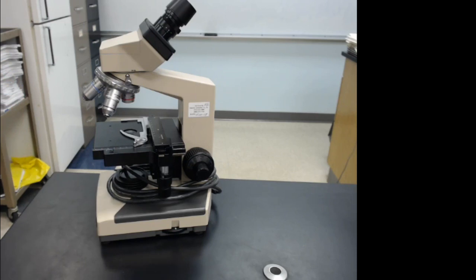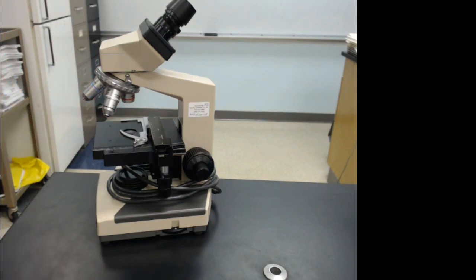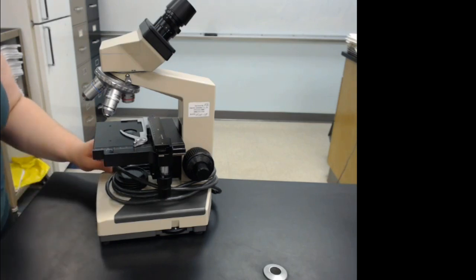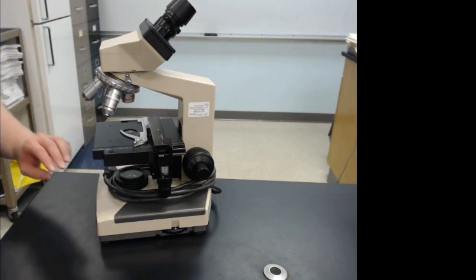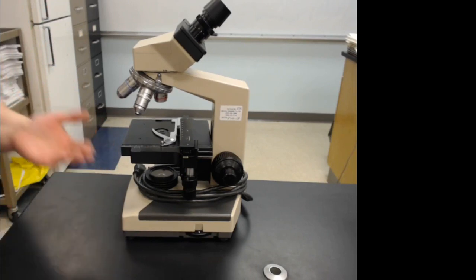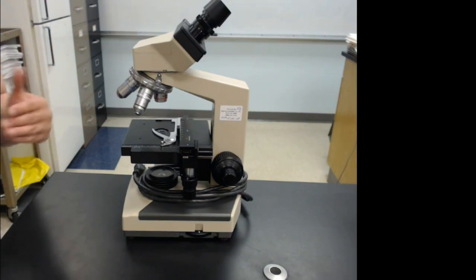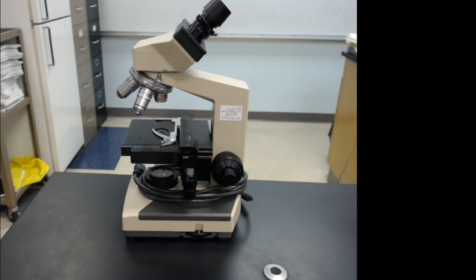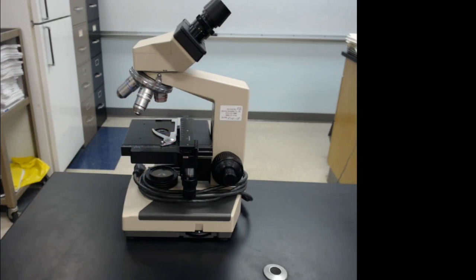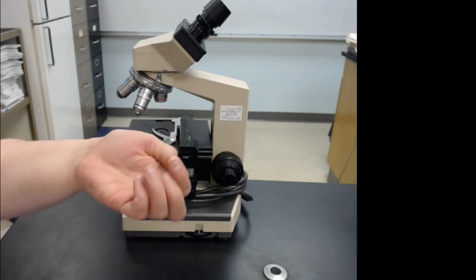When putting the microscope away, move your objective to the lowest one — the 4x — raise the stage all the way up, and wrap the cord around the base. When you are finished, dispose of things where they belong. We save microscope slides to be reused for other classes, but cover slips go in the trash along with any samples.